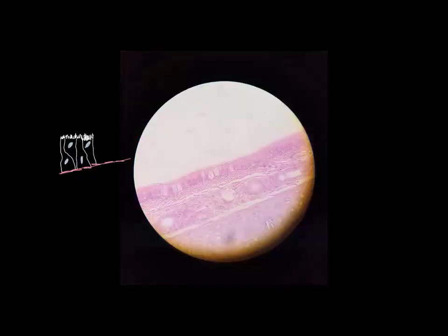This next tissue doesn't really follow the standard naming scheme. It's actually got kind of a weird sounding name. It's called pseudostratified columnar epithelium, or sometimes it's written as pseudostratified ciliated columnar epithelium, because it does typically contain cilia, like in our example here. And the name actually has some meaning behind it. When it says pseudostratified, the root word pseudo means fake or false. And stratified, like we've seen already now, means multiple layers.